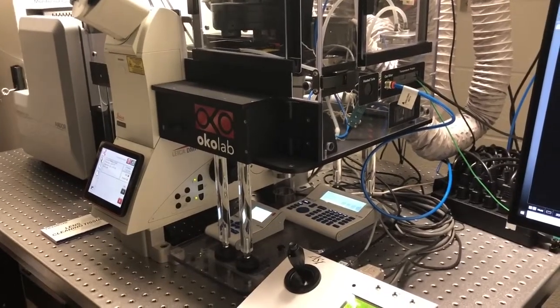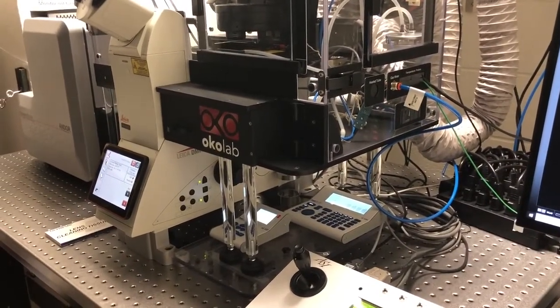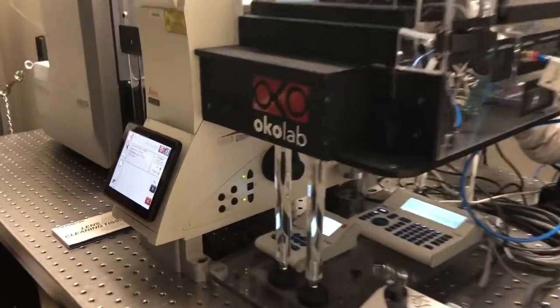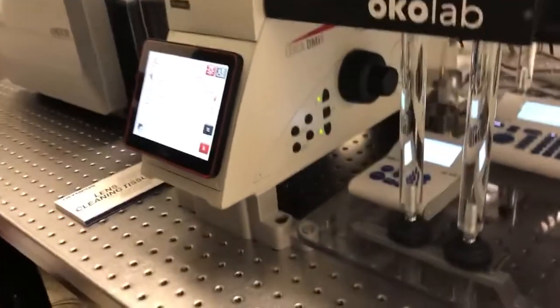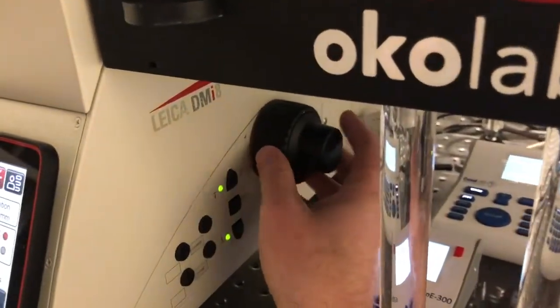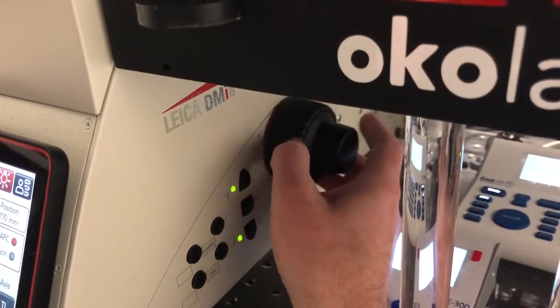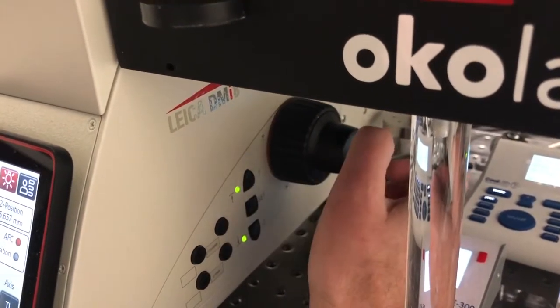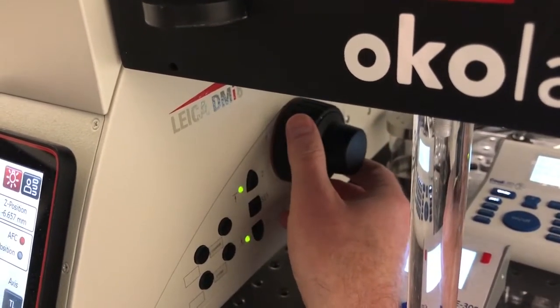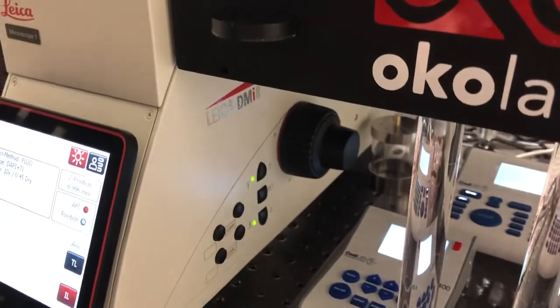I'm now going to discuss some very basic microscope controls. On this microscope, moving the focus knob away from you makes the objectives go up, whereas moving the focus knob towards you makes the objectives go down.